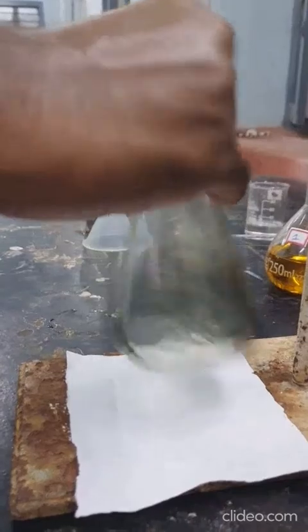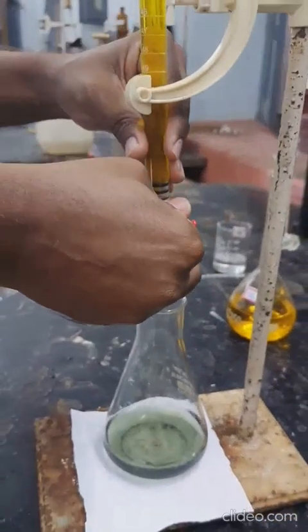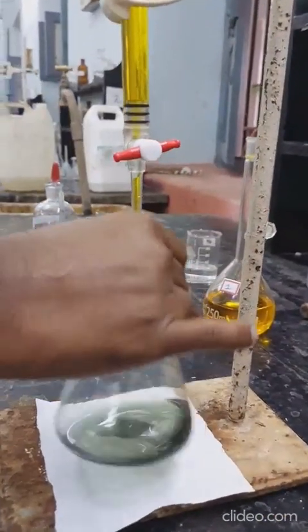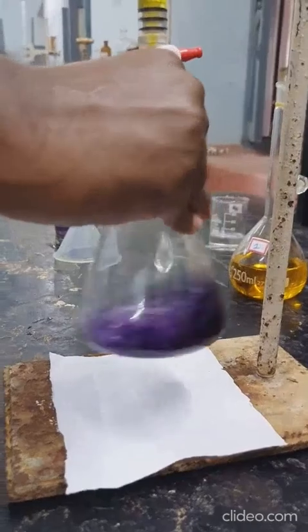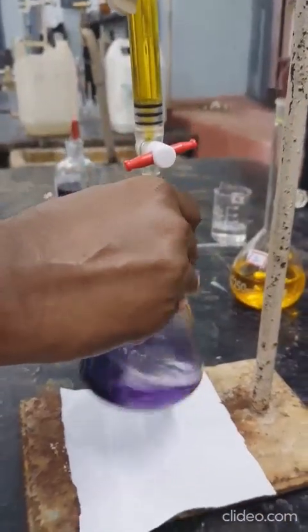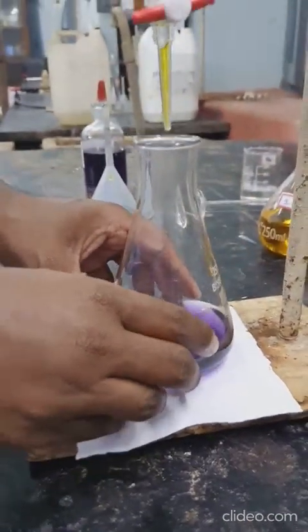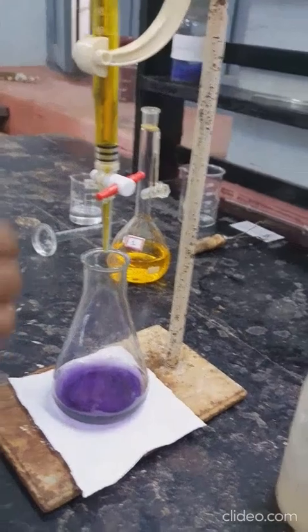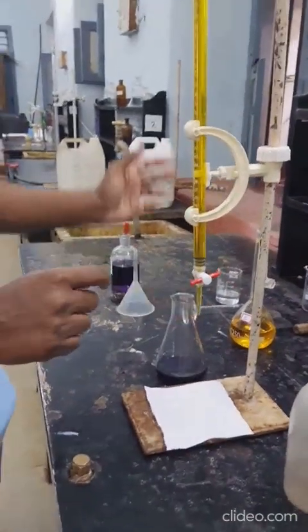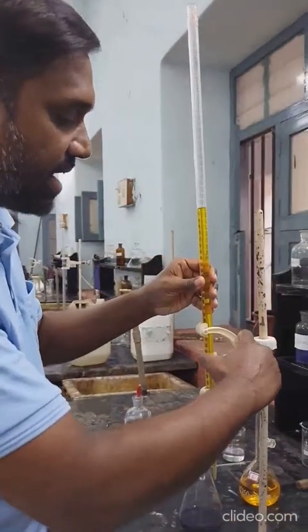Yes. The colour has to be permanent. I think one more drop is required. Can you see a distinct blue colour now appearing and staying for a long time? That means a permanent colour change has happened. You noticed that this colour change happened after addition of one drop of the burette solution. In this way, an accurate titration should be executed. Once you are satisfied with the colour change, you decide the end point is achieved. Take the final burette reading.